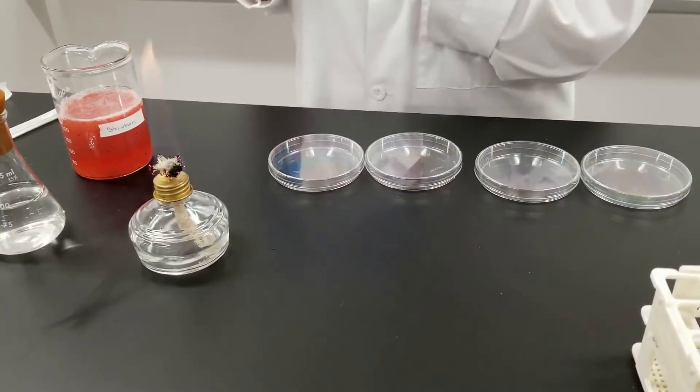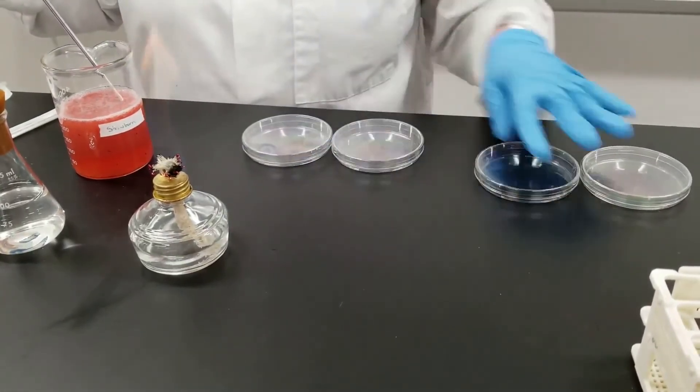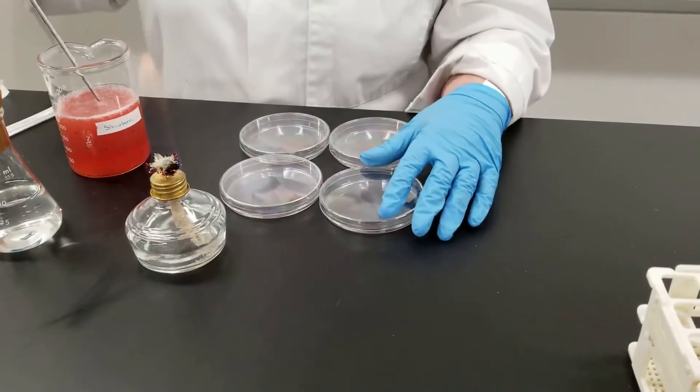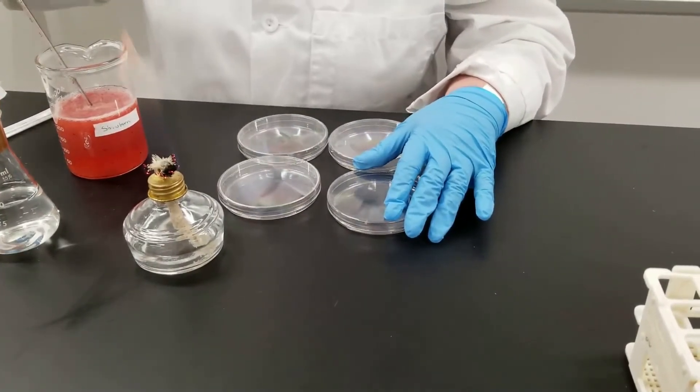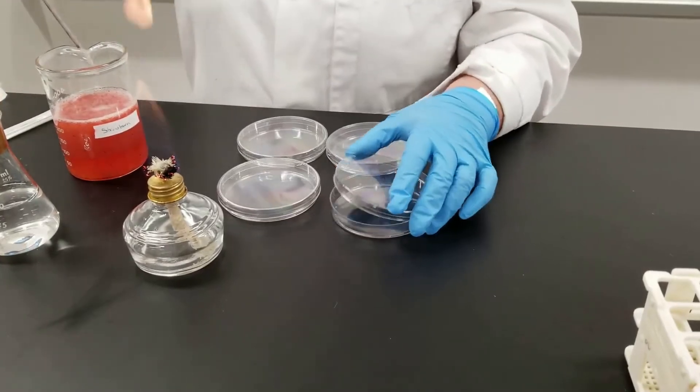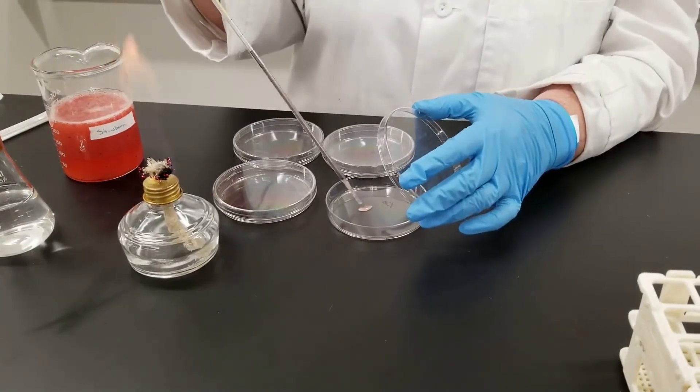We're going to do pour plates for this. So we will start off first by taking a milliliter. The sample has already been diluted, as I said.